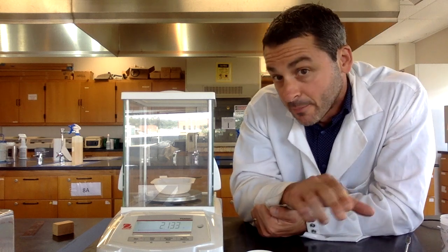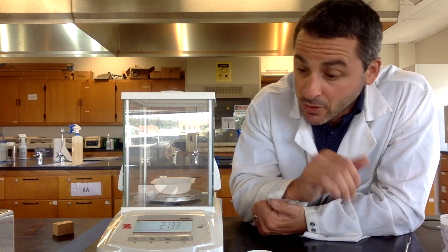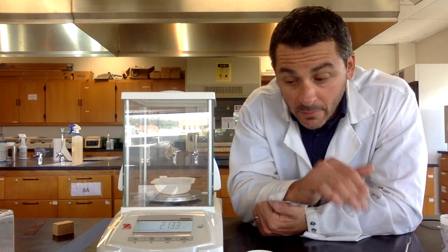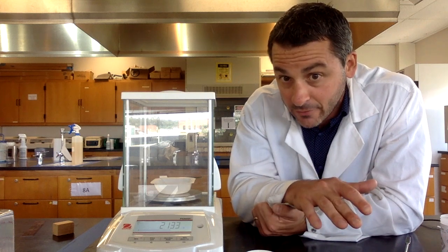It says 2.133 grams. The balance is highly accurate, so you record all the numbers from the balance. You don't round off. The balance is accurate, so write down all of those numbers.